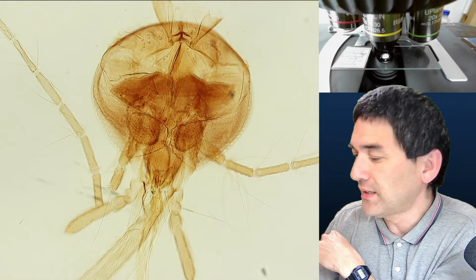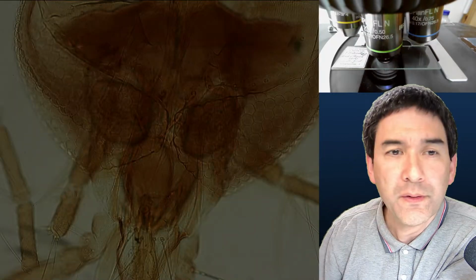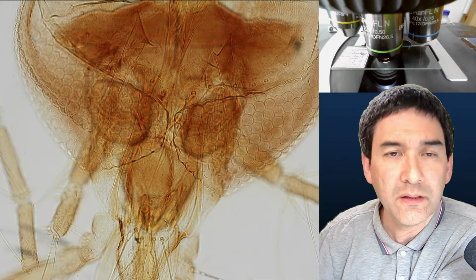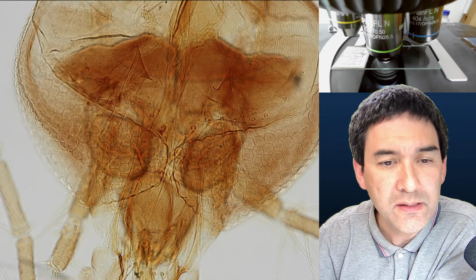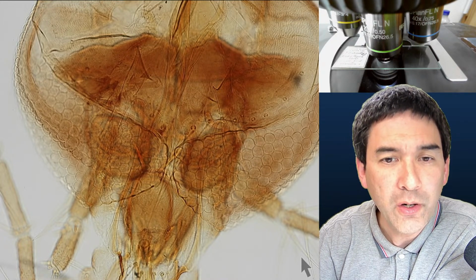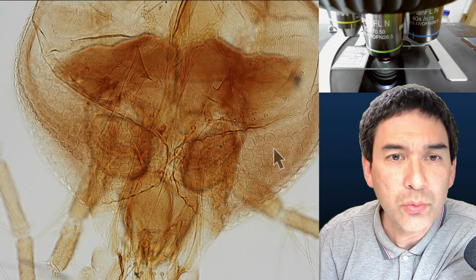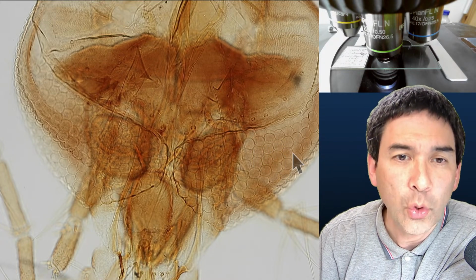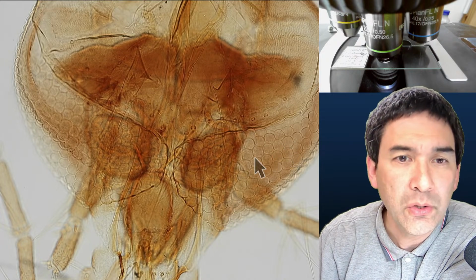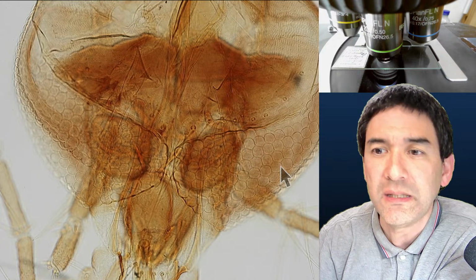So, okay, that's how it looks. And we go up a little bit with the magnification. If you already joined in last week, then you know that we had a little discussion about where the eyes are. And the eyes, if you see those little hexagonal structures here, these are the individual elements of the eye, the so-called ommatidia. And because they're pretty transparent, I think the sample here is bleached.